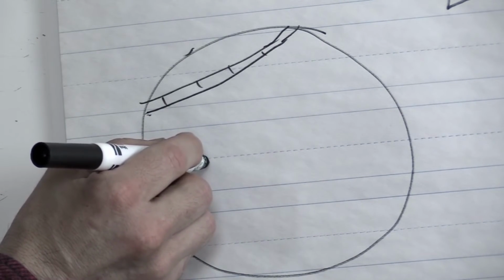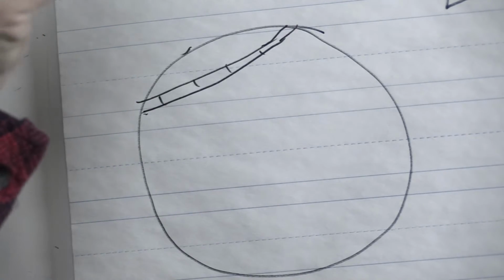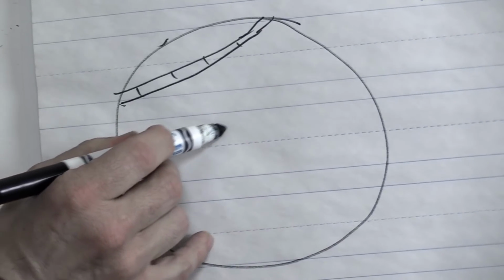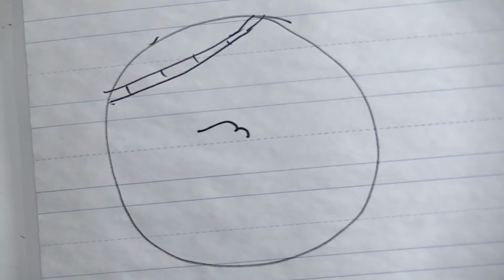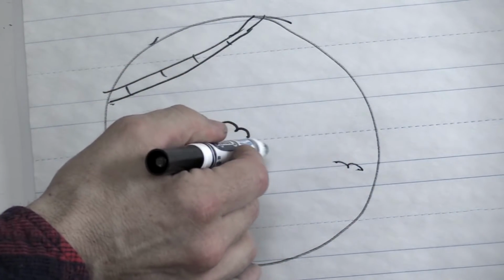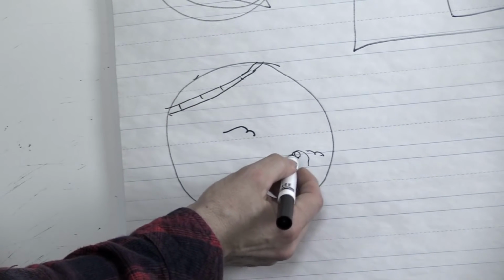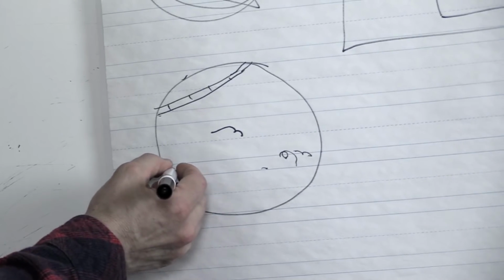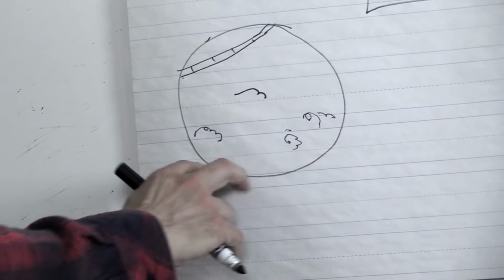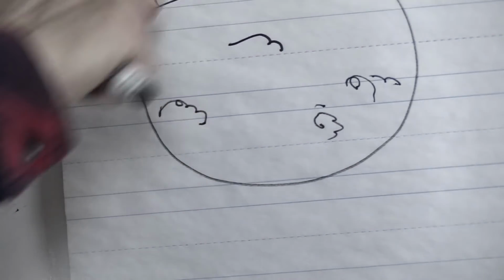And then we're going to be looking for movement of flagellates. Generally, you're going to want to use your shadow feature to shadow this and make it a little bit darker, and then you can see more movement. You'll notice that if it's too light, you may miss a lot of these flagellates. And then as you use shadowing, you can see them move around. So you might see one over here, so you'll count that one. You might see one over here, so you'll count that one. So in this field of view, we had 2 flagellates and 1 fungal hyphae.